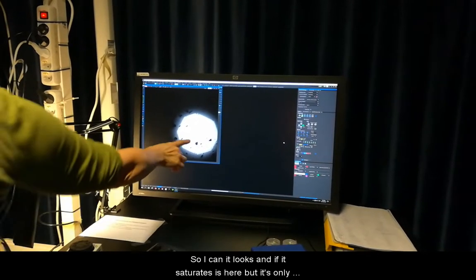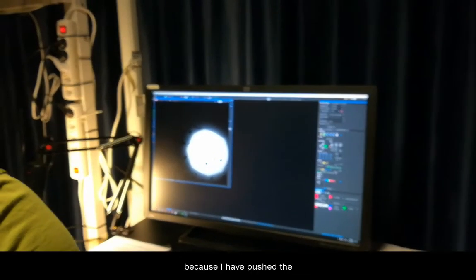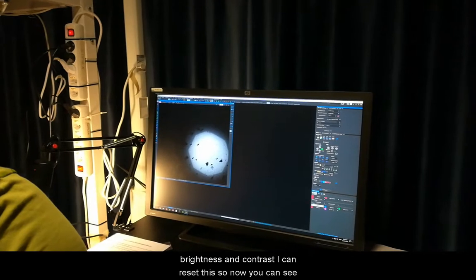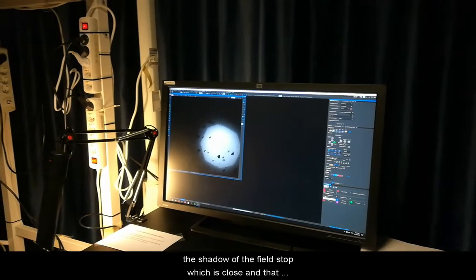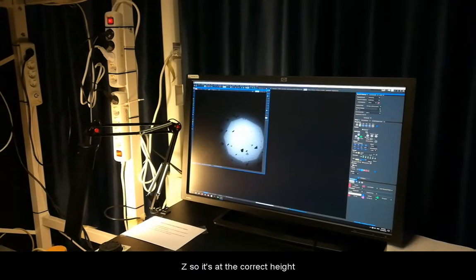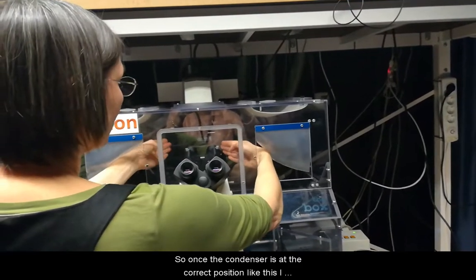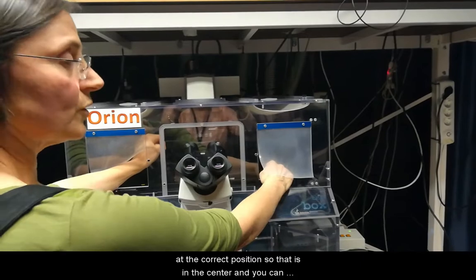It looks a little bit saturated because I pushed the brightness and contrast — I can reset this. Now you can see the shadow of the field stop, which is closed. That means my condenser is now at the correct position in Z — it's at the correct height. Once the condenser is at the correct position in Z, I also need to bring it in XY at the correct position so that it's centered.